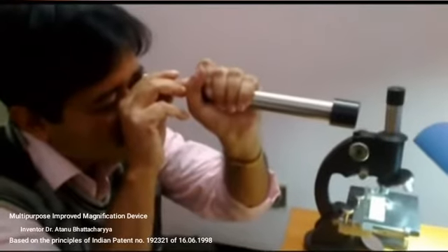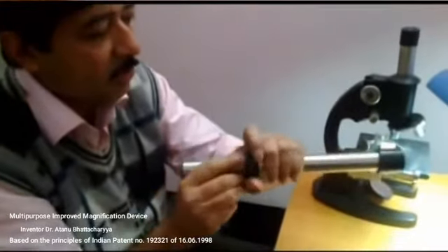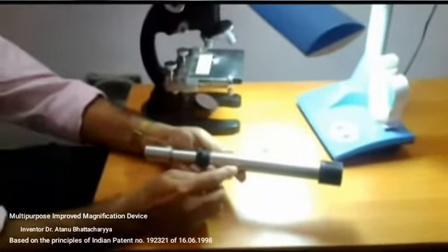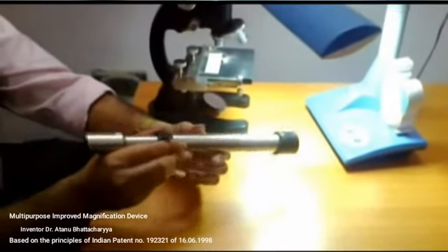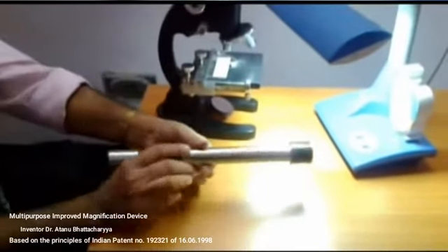So it may be used as a field microscope also. The same device, the field microscope, as the telescope also. So it is a device which may be used as a field microscope as well as a telescope. And for the field microscopic view, no slide preparation is needed, so the children can also use it very easily.